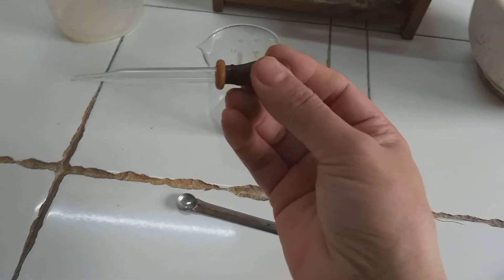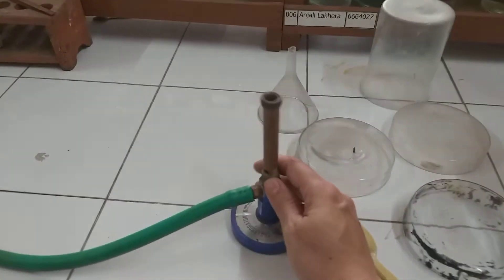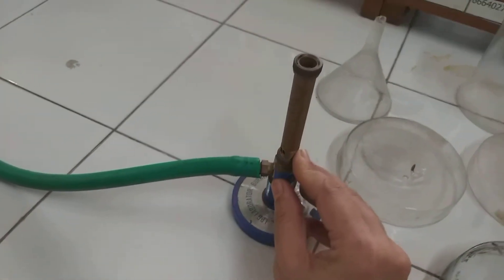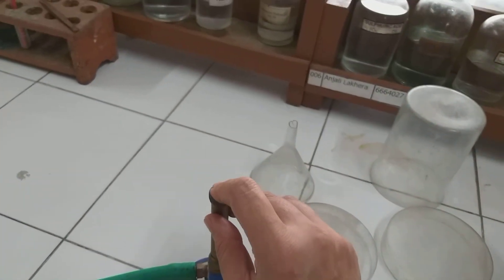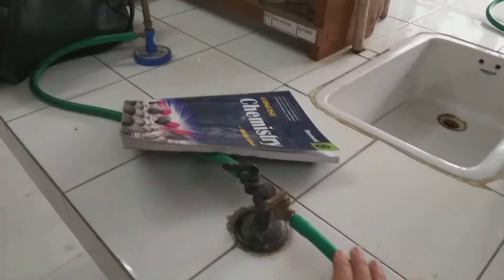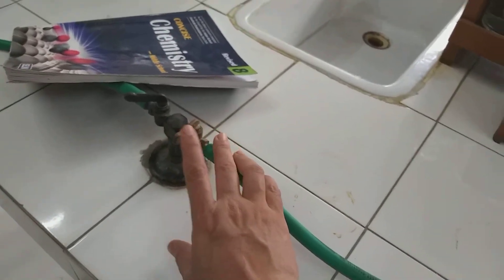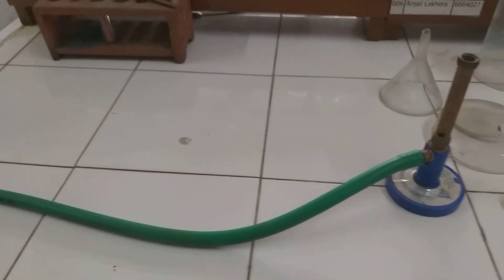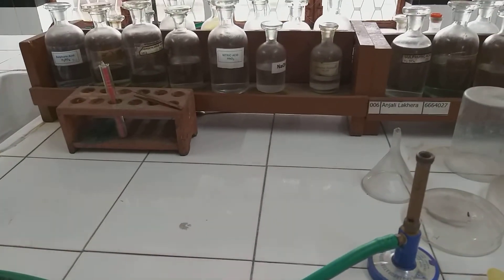This is a dropper, as you already know. Now I'll show you one more very important apparatus — this is called a Bunsen burner. It has openings through which the gas comes out and burns. The Bunsen burner usually runs on LPG gas. This is the knob for opening and closing the gas. I'll show you the remaining apparatus later in another video.